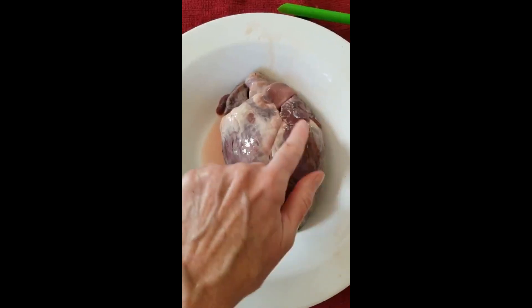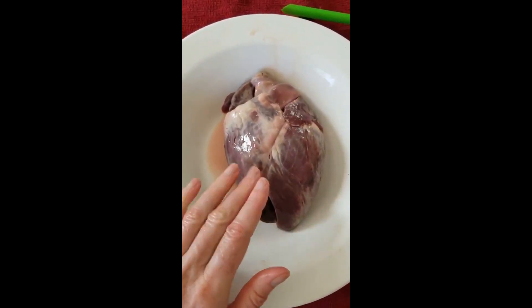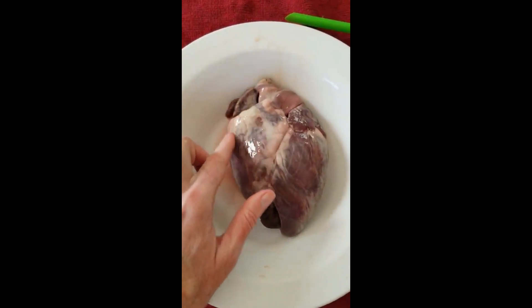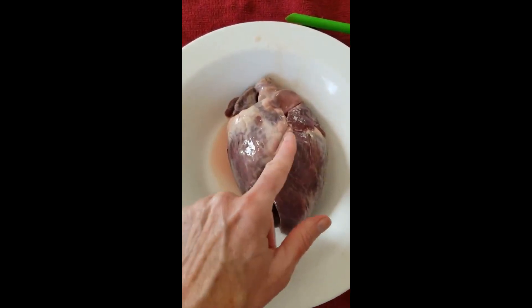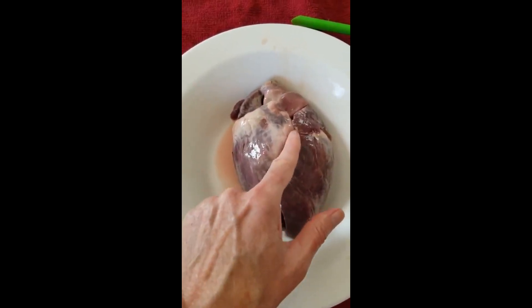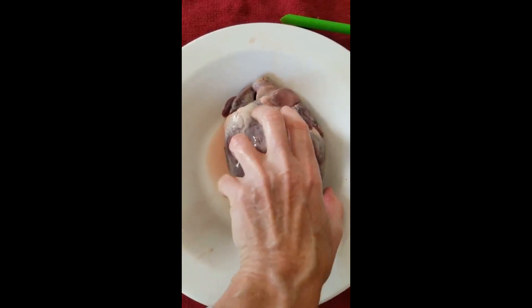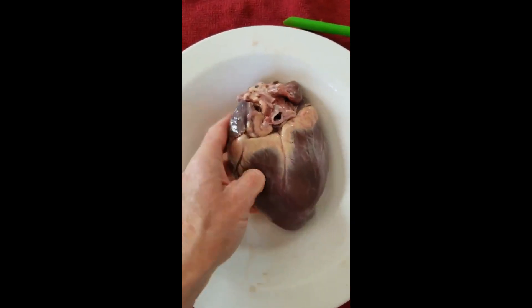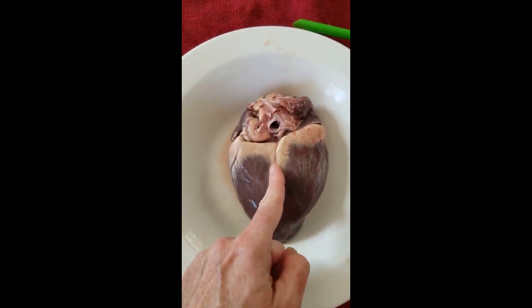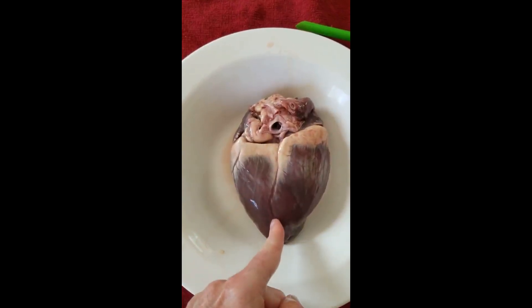This is the left side of the heart here. Remember when you're talking about left and right in anatomy you're talking about the patient's right and left. This is the right side of the heart over here, so this is a big cardiac artery that goes diagonally across — that's how we can tell that this is the front side of the heart, the ventral side. If we turn it over, this is the dorsal side of the heart, and it also has a big vein but it cuts more straight up and down on the heart.